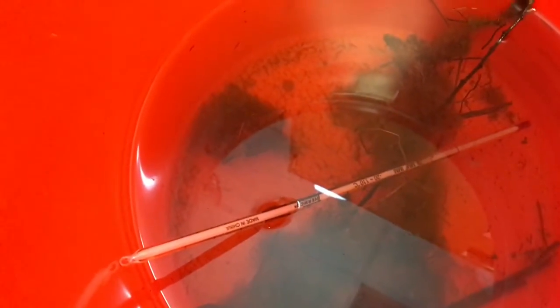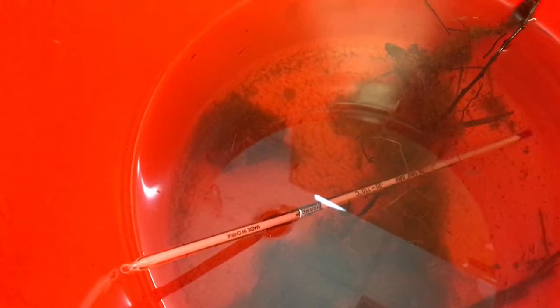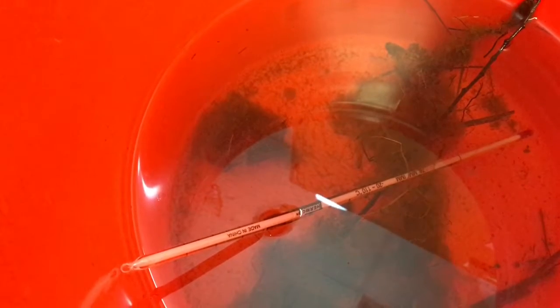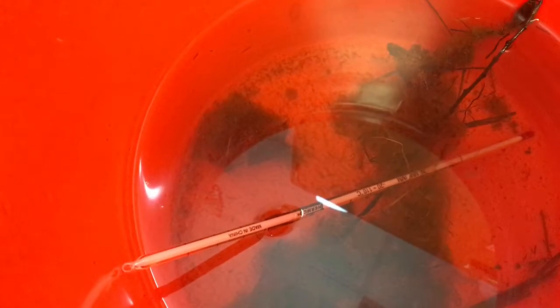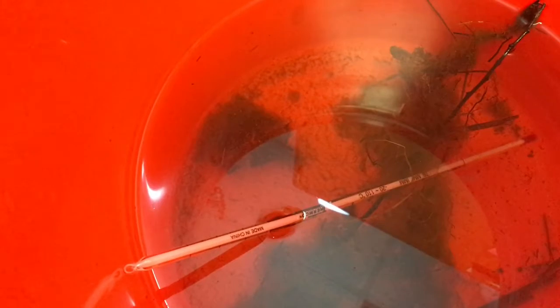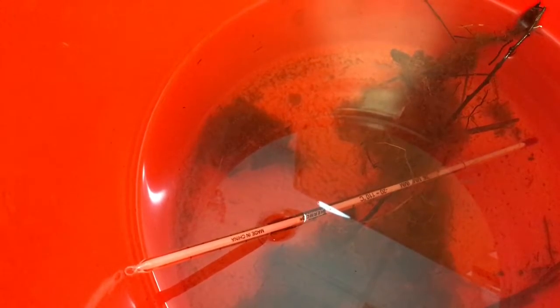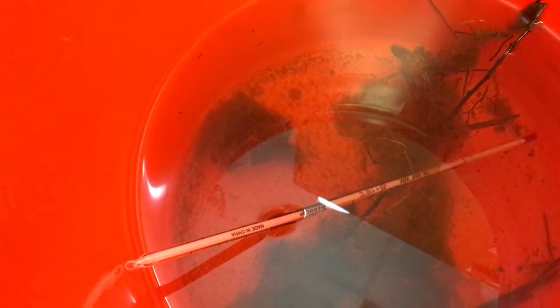The first thing we're going to test is temperature. Temperature is important to aquatic ecosystems because it can impact the amount of dissolved oxygen in the water, how quickly plants can perform photosynthesis, and how much pollution plants and animals can tolerate.